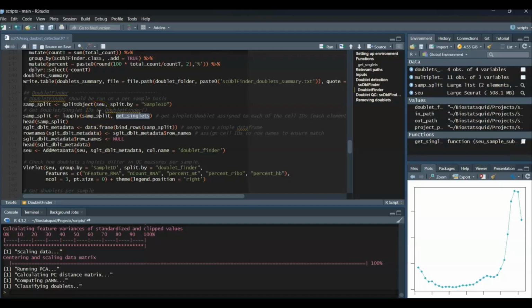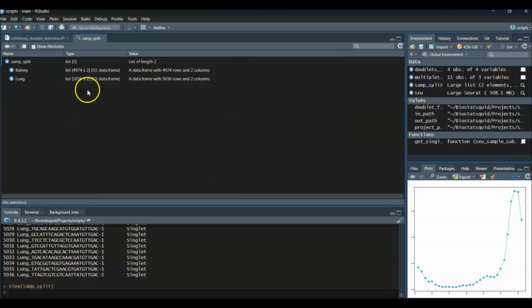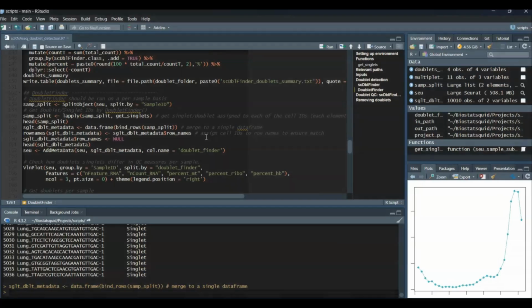Once we have that, if we take a look at the results, we will have a list of data frames, one for every sample. I printed out everything, but we can maybe check this out. So as you can see, we have a list of data frames per sample, and we have the cell IDs as row names, and the DoubletFinder labels here as another metadata column.